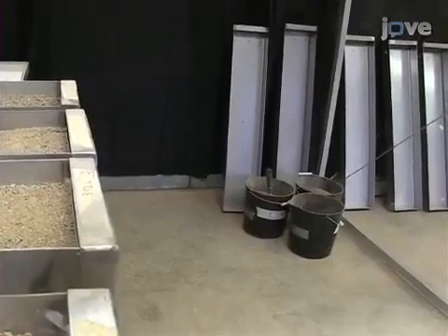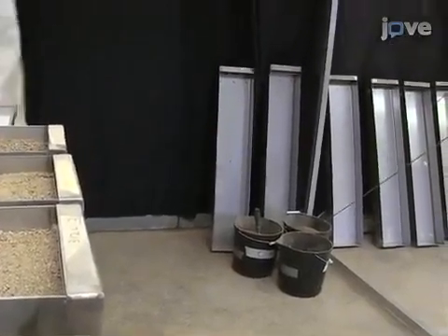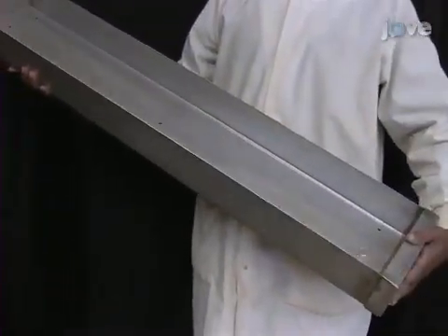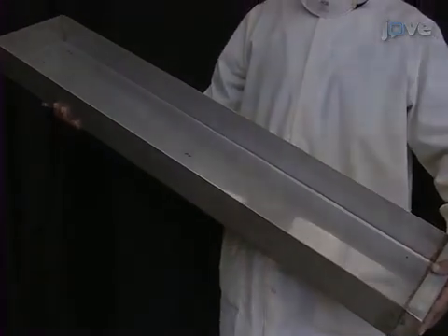Begin the protocol by procuring boxes of identical dimensions. These boxes are 100 centimeters long, 20 centimeters wide, and 7.5 centimeters deep.